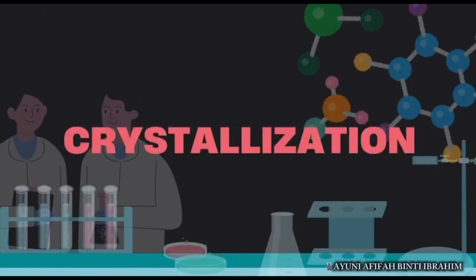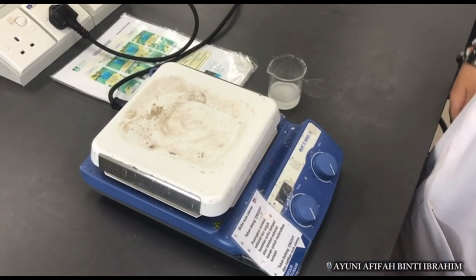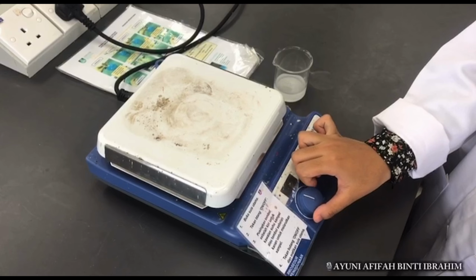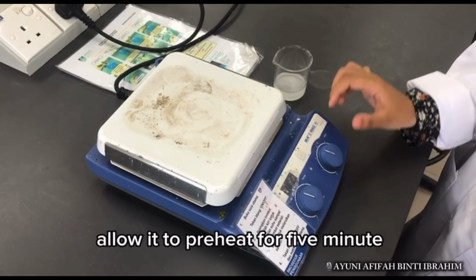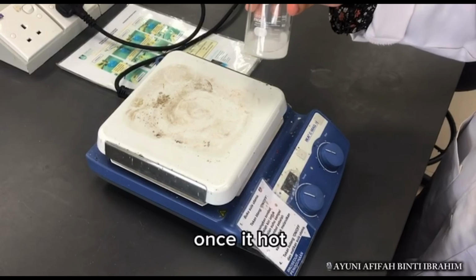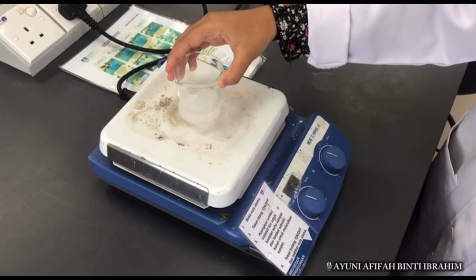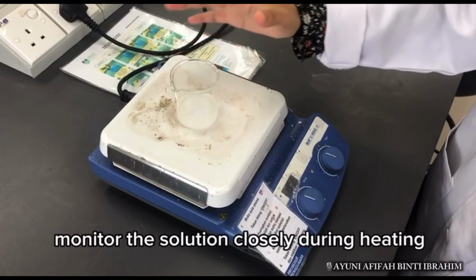Step number 3, crystallization. Turn on hot plate and set it to 60 Celsius. Allow it to preheat for 5 minutes. Once it's hot, carefully place the beaker on top of the hot plate. Monitor the solution closely during heating.